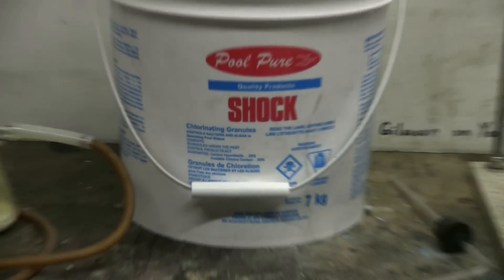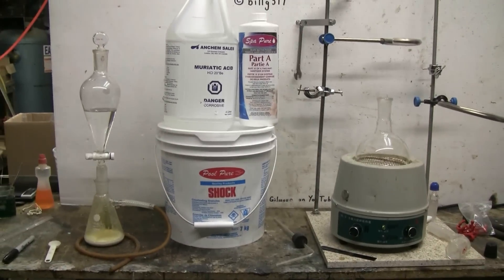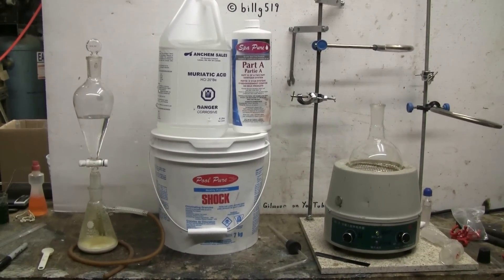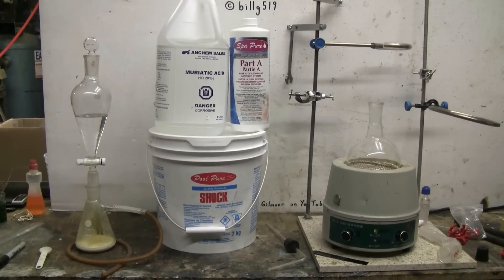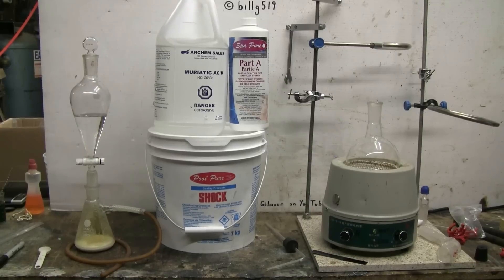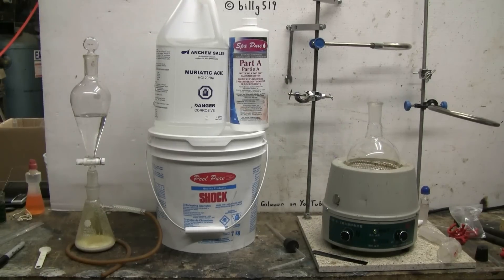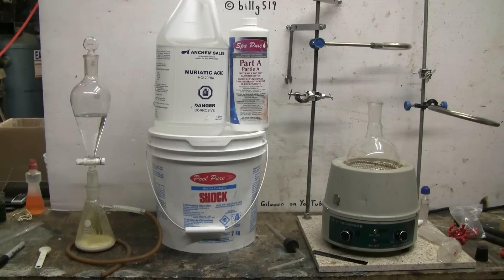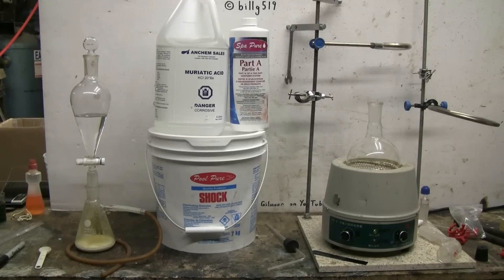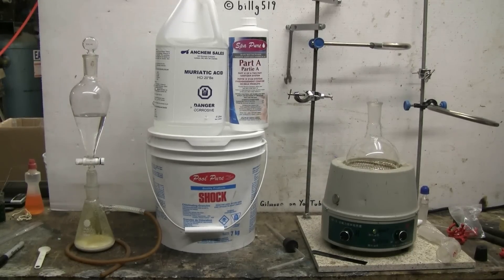The chlorine gas will be bubbled through the sodium bromide solution. The chlorine will displace the bromine and we'll be able to distill off the bromine and save it in an ampoule. Or at least that's the idea - let's give this a try.